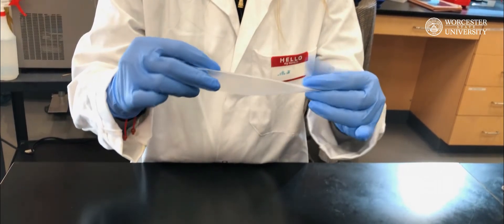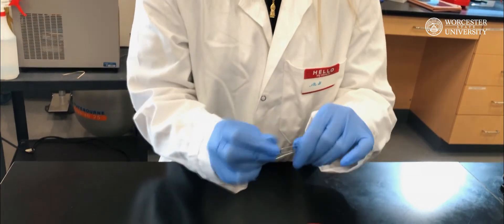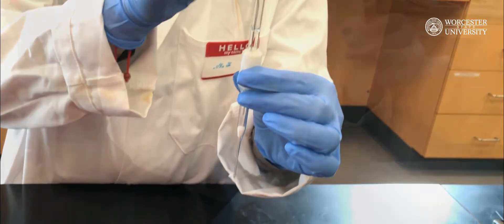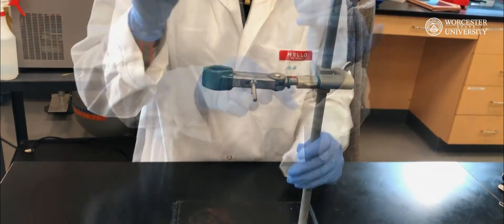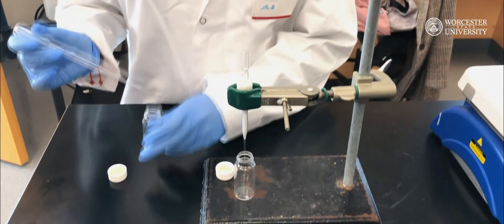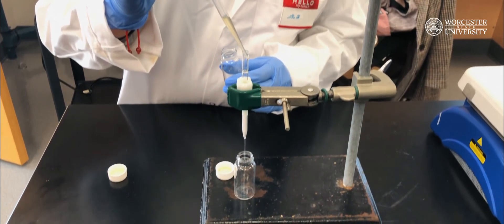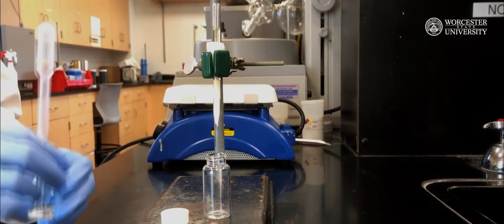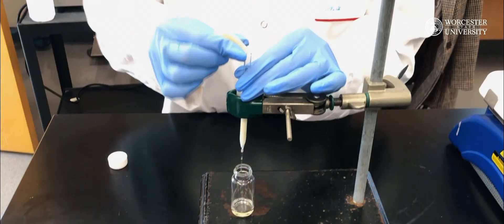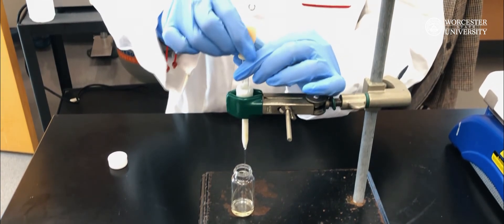First, wrap parafilm around a glass pipette to increase the area so that the pipette can be clamped into the stand. Obtain a paper clip and unfold it. Using this unfolded paper clip, plug the pipette with cotton wool. Then fill the pipette with 2 to 3 cm of silica gel. Filter the solution into a pre-weighed 20 mL vial through this plugged pipette. Rinse the column with a small amount of ethyl acetate. If the filtration is too slow, attach a bulb to the top of the pipette and gently squeeze it to speed up filtration, keeping it squeezed until you remove it.